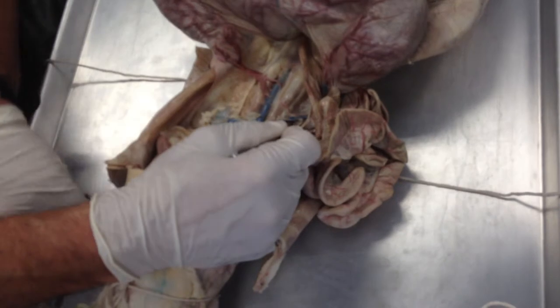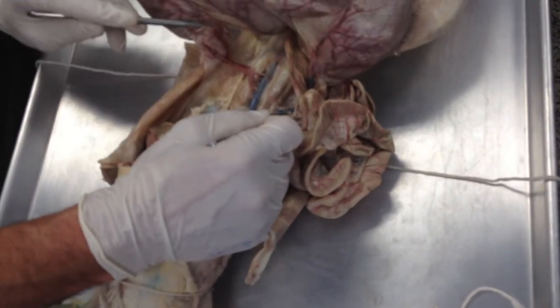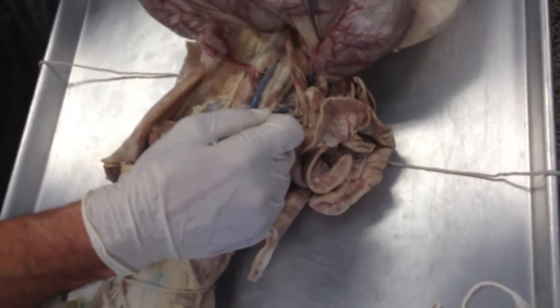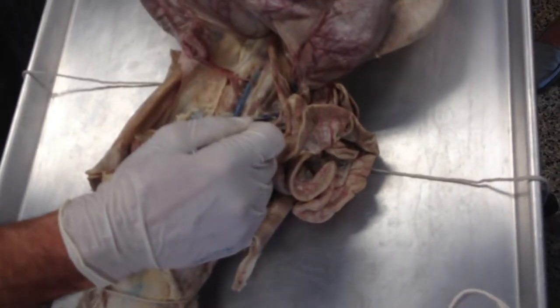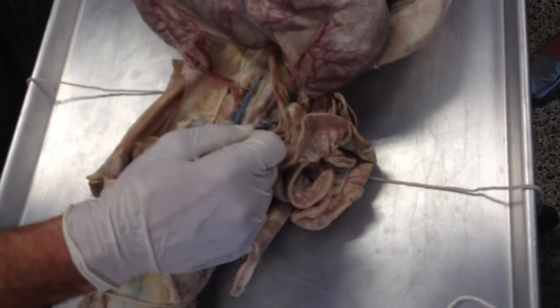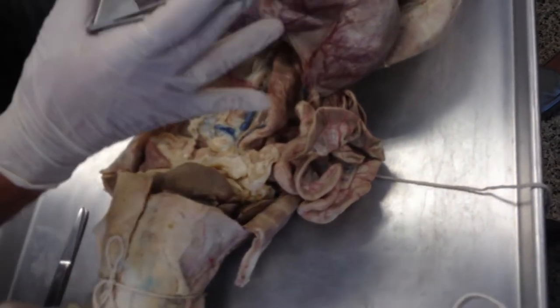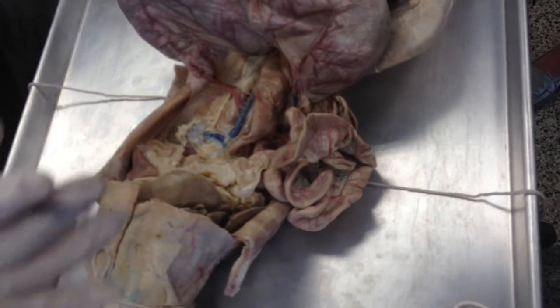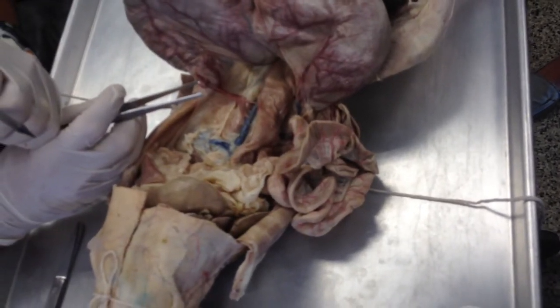It runs into the inferior vena cava. Most times you're not looking there, but you're looking at where it is right here, and all of these are branches of the ovarian vein. And then when she's not pregnant anymore, what happens to those — that ovarian vein — it just atrophies down like that.